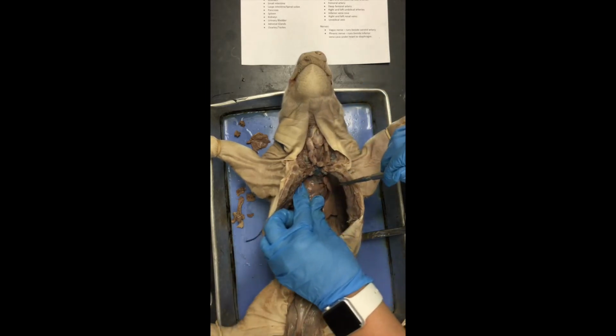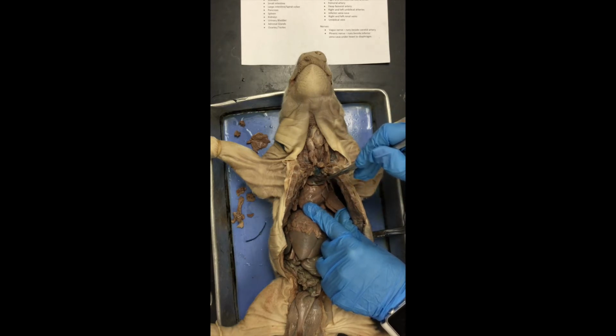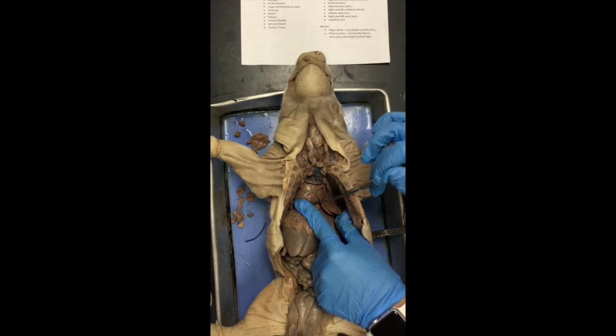Now, looking at the heart itself, the heart has 4 chambers. This chamber here is known as the right auricle. Now, you might have heard the word atrium before, right atrium? The atrium is the chamber that's inside the auricle. So your blood flows through the atrium. But this pouch right here, the physical outside surface that we're able to see, this is called an auricle. So this is the right auricle. Right here is the left auricle. There are 2 pouches, okay? And the atria would be the chambers within these pouches.